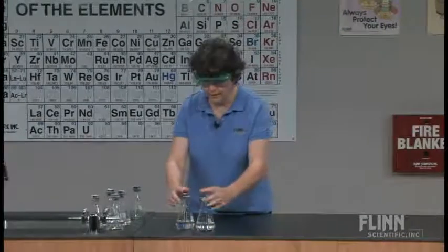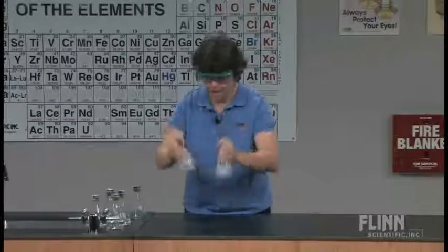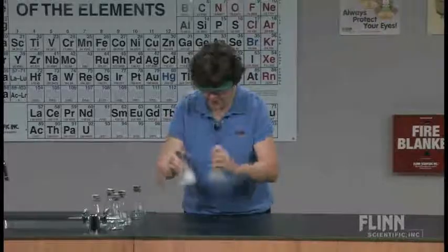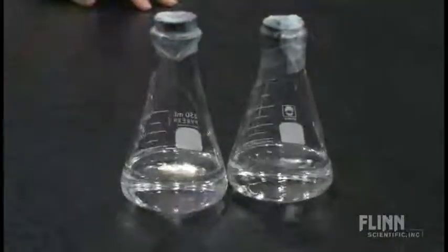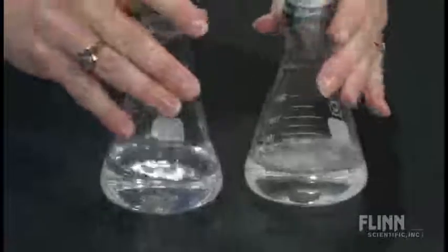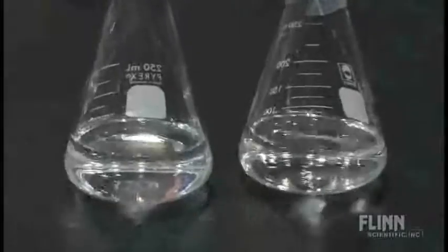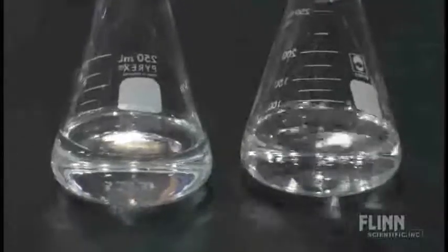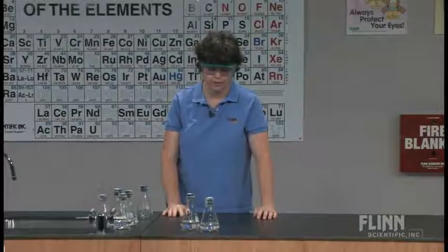The other thing I can do is shake them up quite vigorously and watch the bubble formation. You can see the bubbles don't form too well in the pentanol, because that means they have to break through those intermolecular forces.